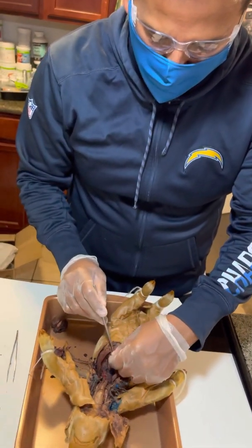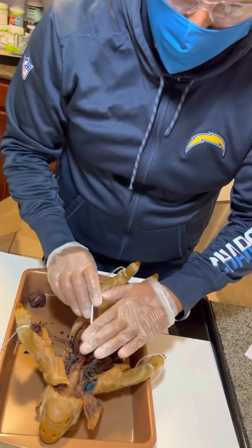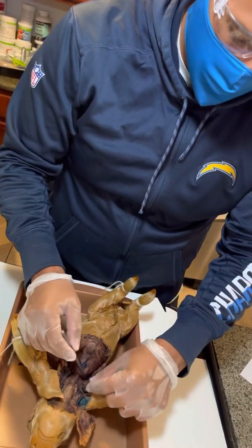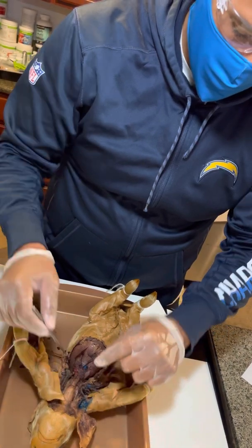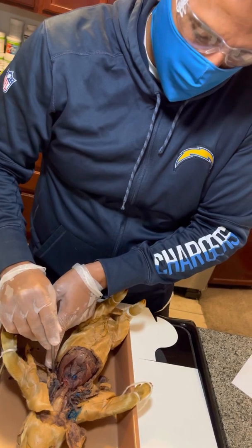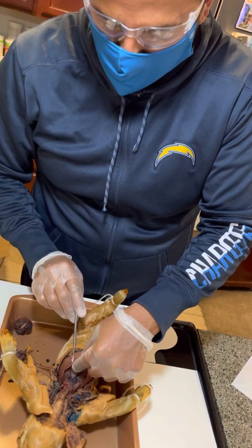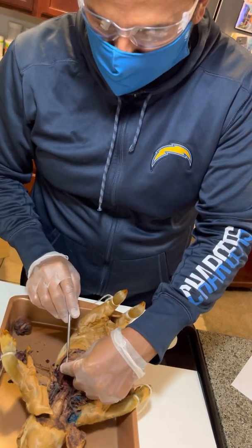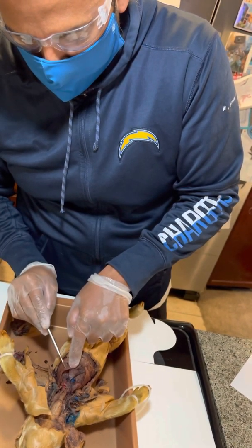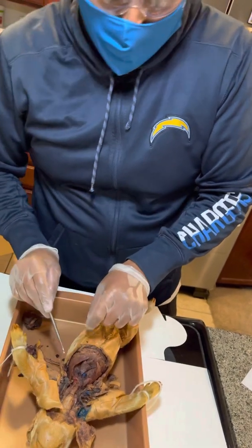Here is our diaphragm right here, and this is what would encase the chest cavity. Okay, on the part of the ribs here is our parietal pleura, and this here is our visceral pleura. It's a little sheet that covers the lungs. We can watch when we press them in, you squeeze, we can see the little sheet right here.